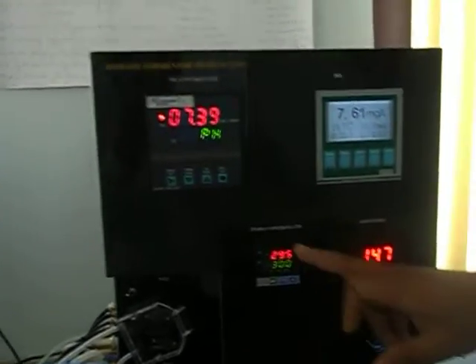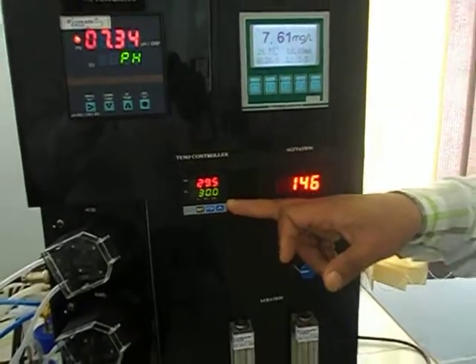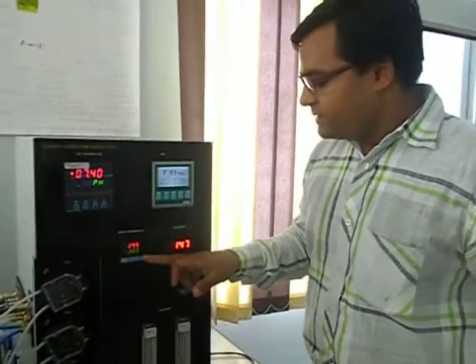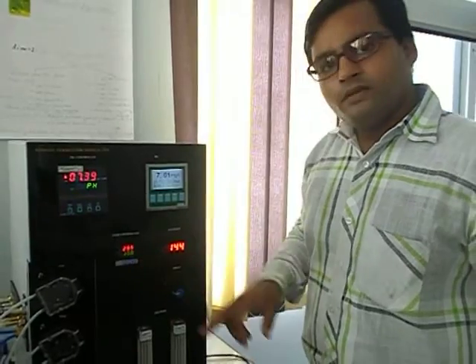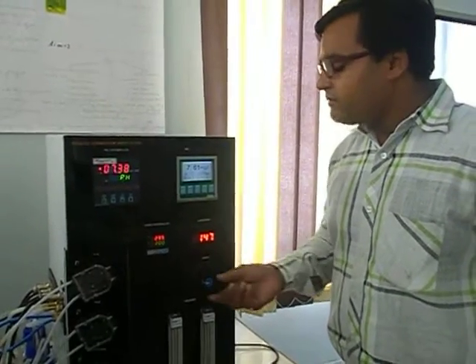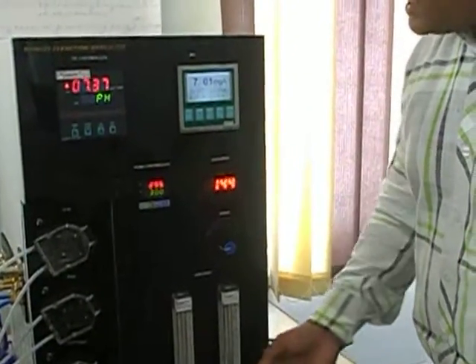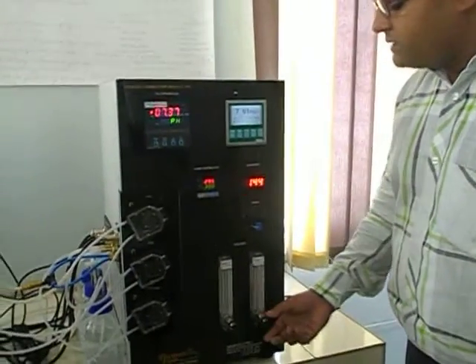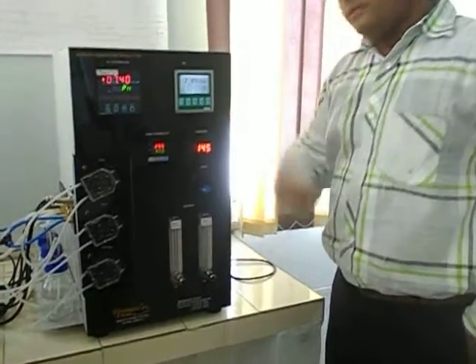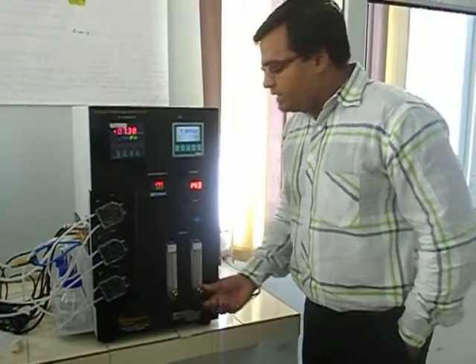Next is the PID temperature controller. Next is agitation — for RPM control, we can control the motor RPM. Next, we have the rotameter for the air.